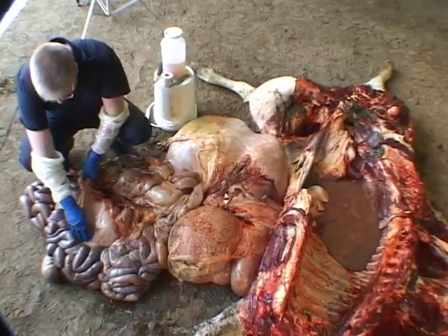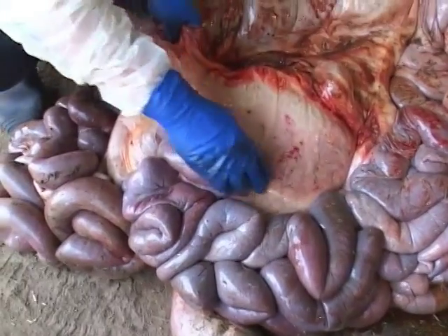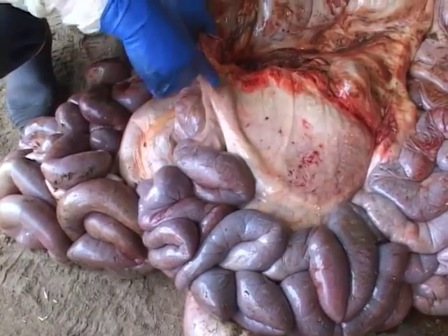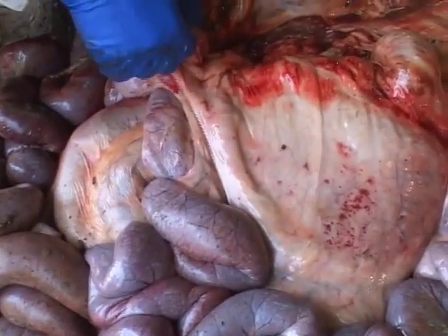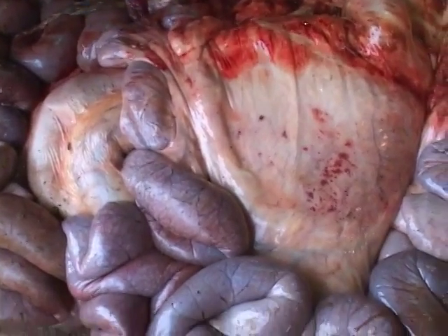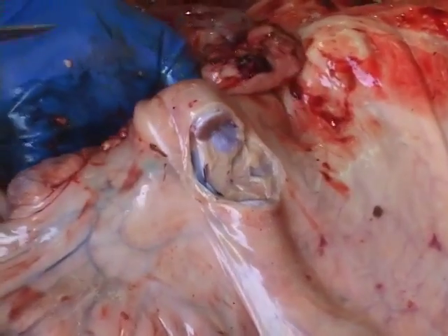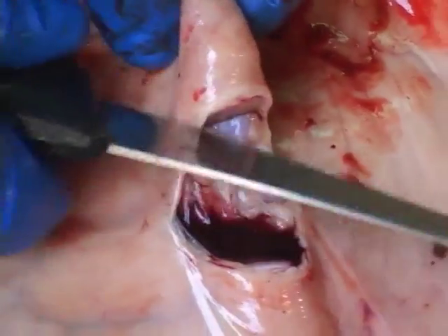The mesenteric lymph nodes should also be inspected. This long chain of lymph nodes is located along the mesenteric margin of the intestinal loops. Use your knife to partially dissect out the chain and visually inspect them. Individual lymph nodes can be isolated and incised for further inspection and microbiology testing.